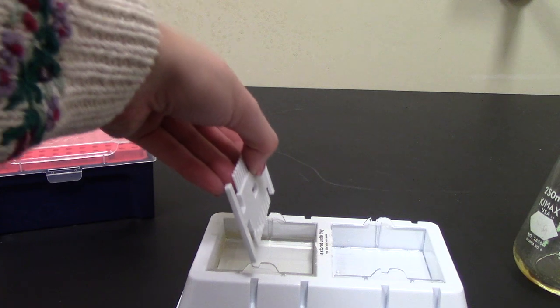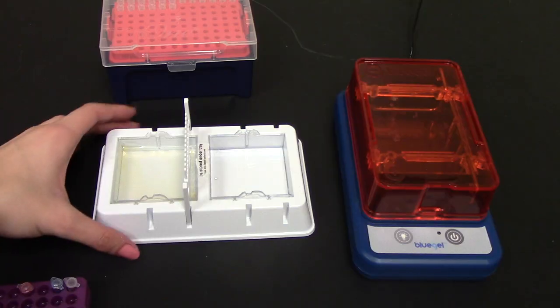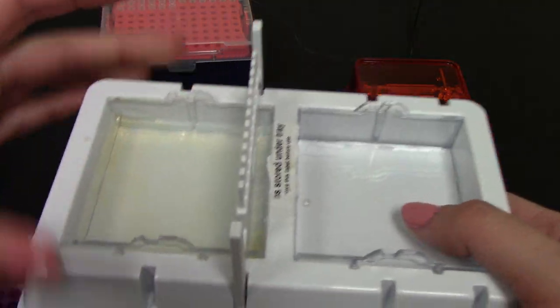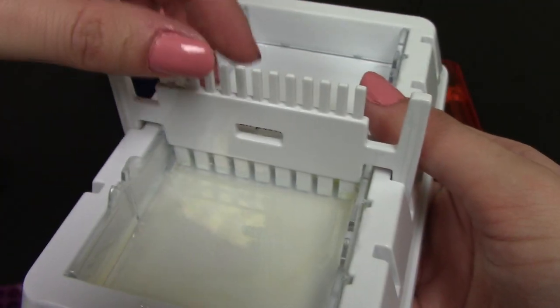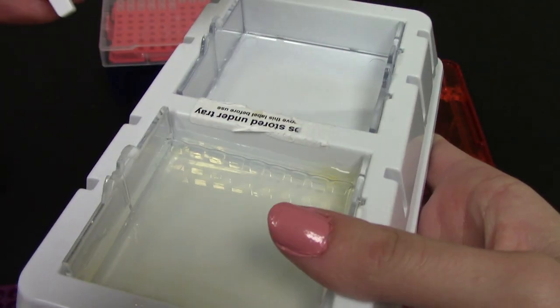I'm going to put in my combs and I am going to let that set until it is solid. Now that my gel is done, I am going to remove the comb very carefully and there are my wells.